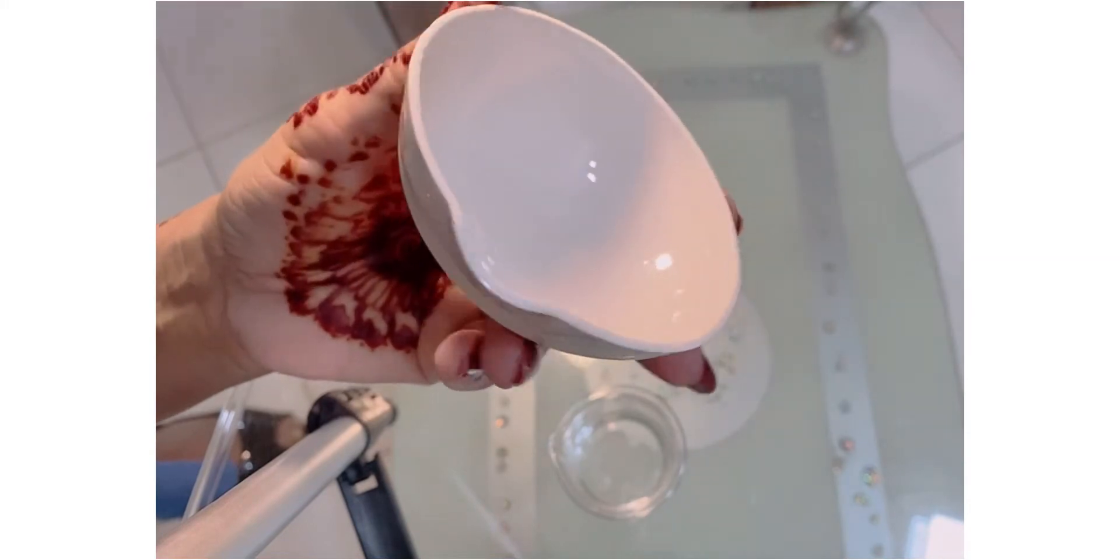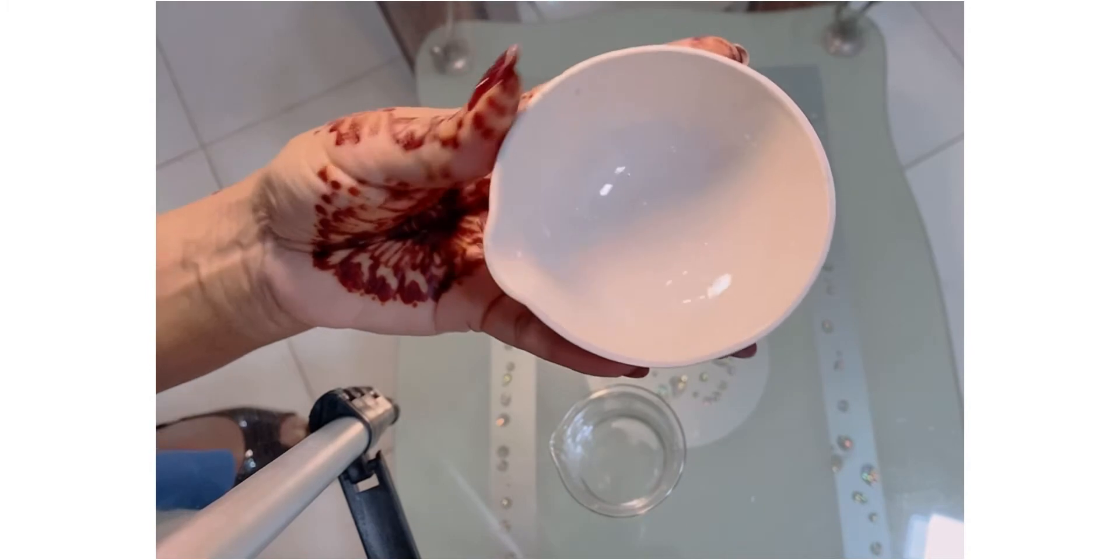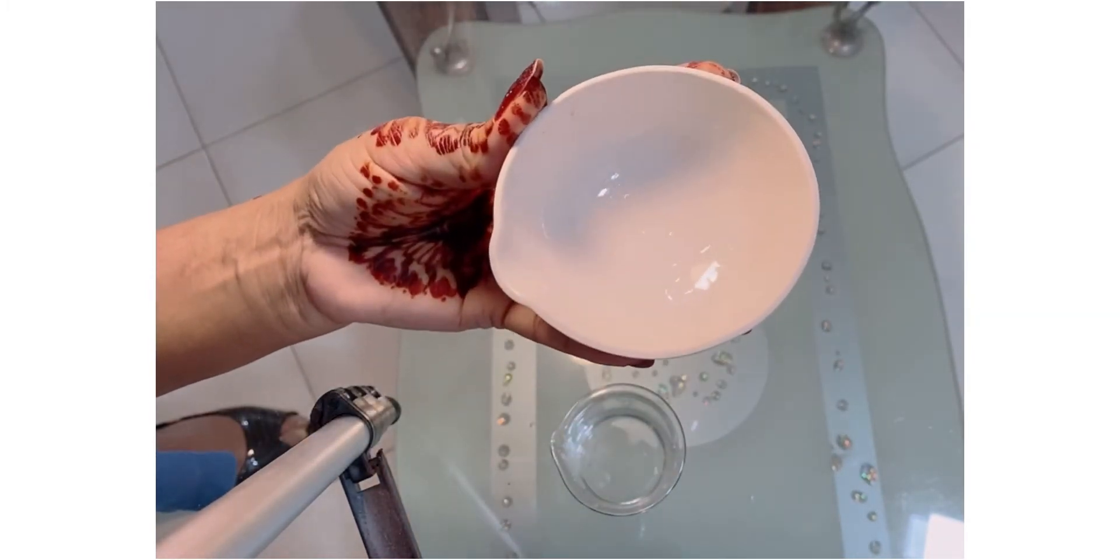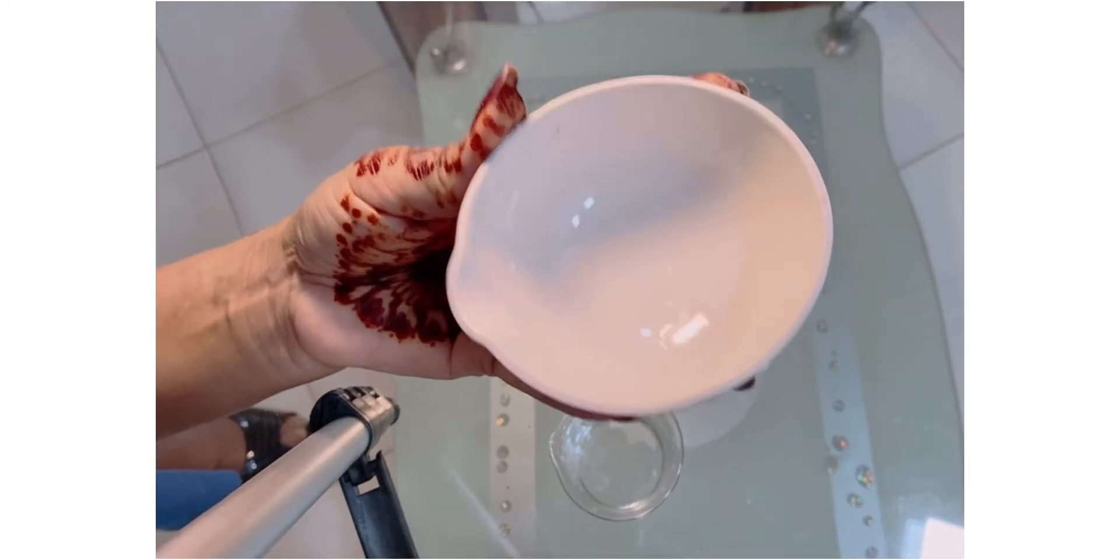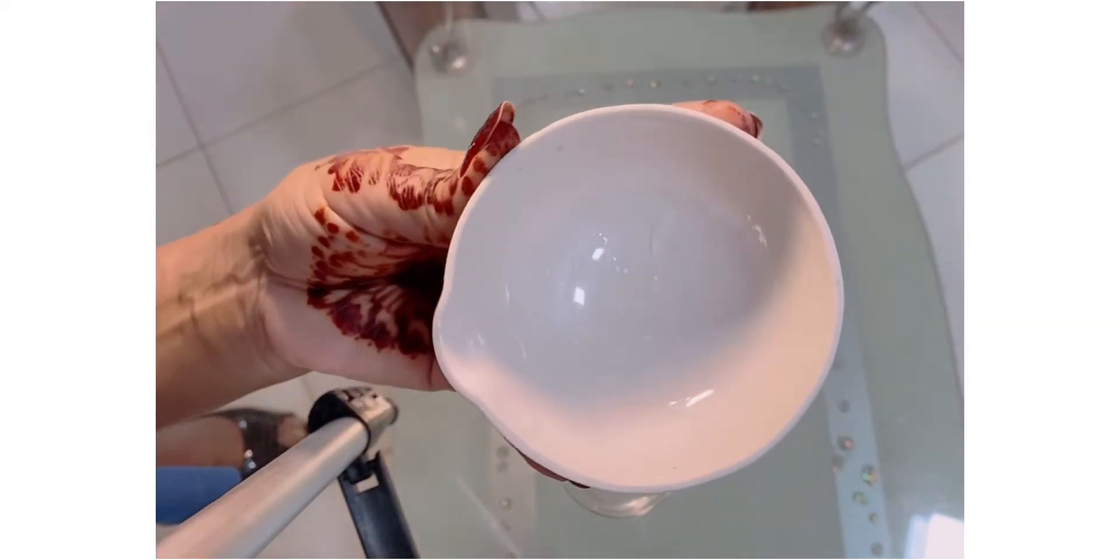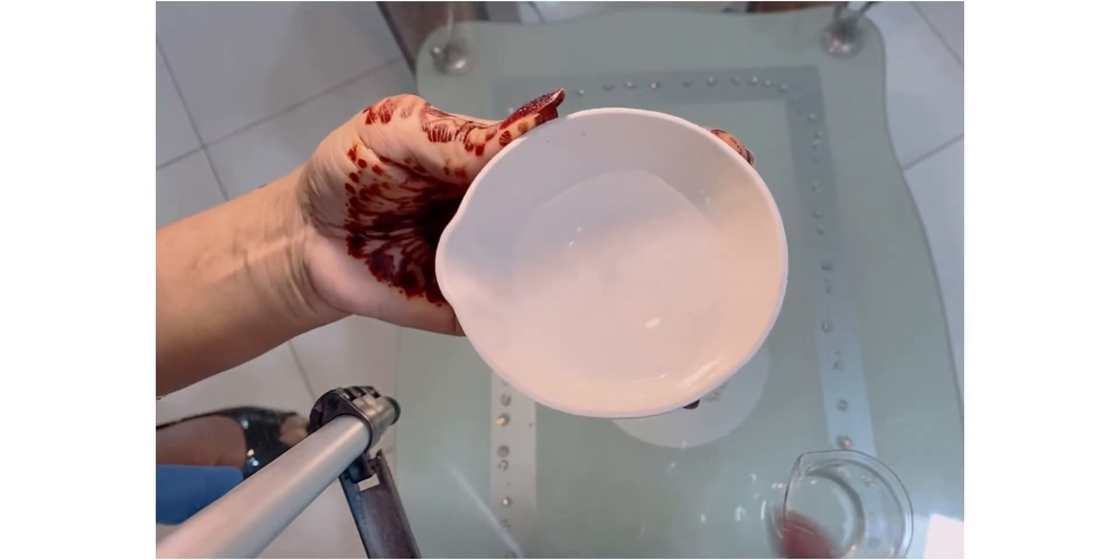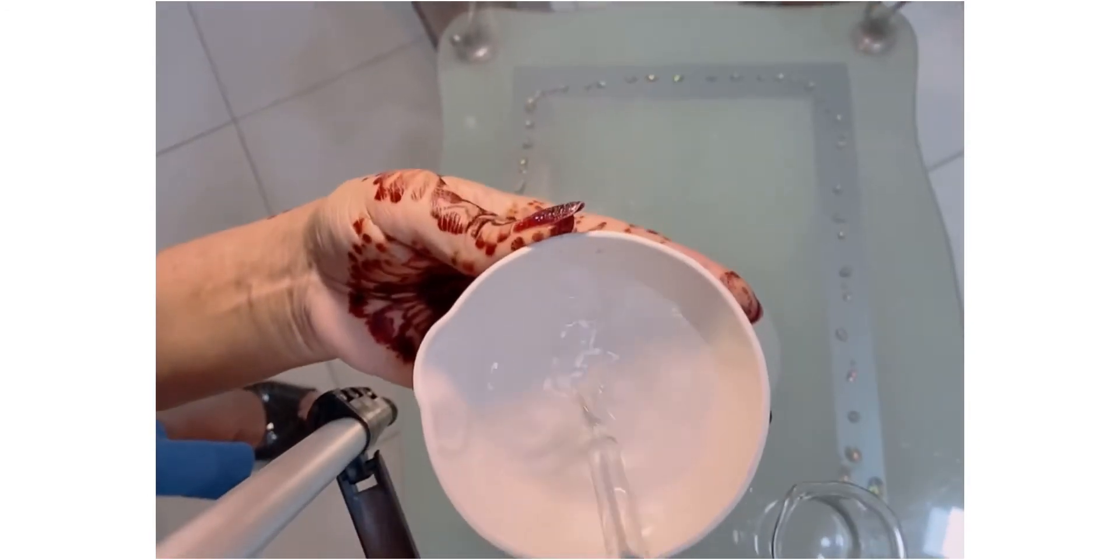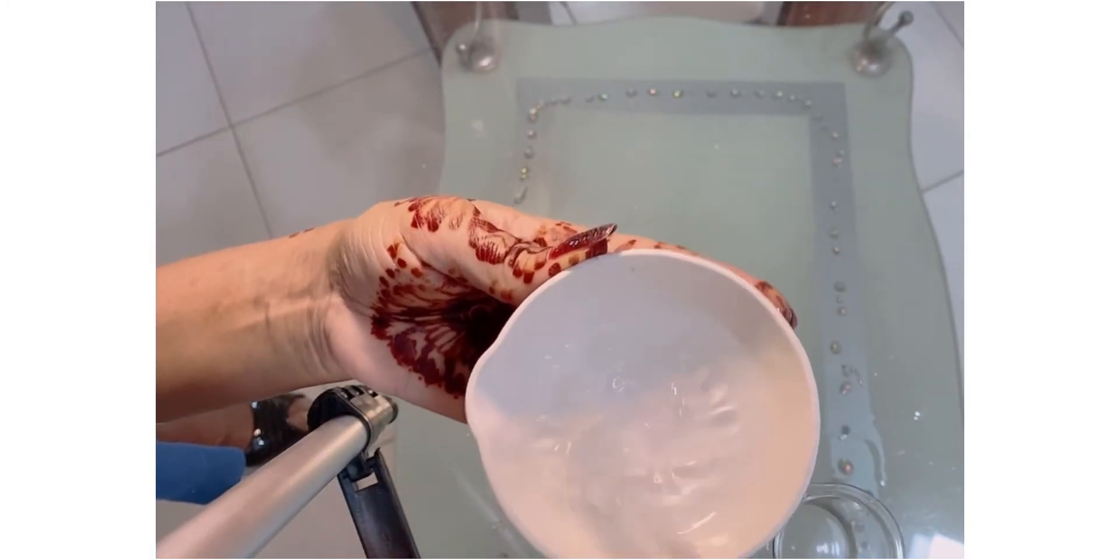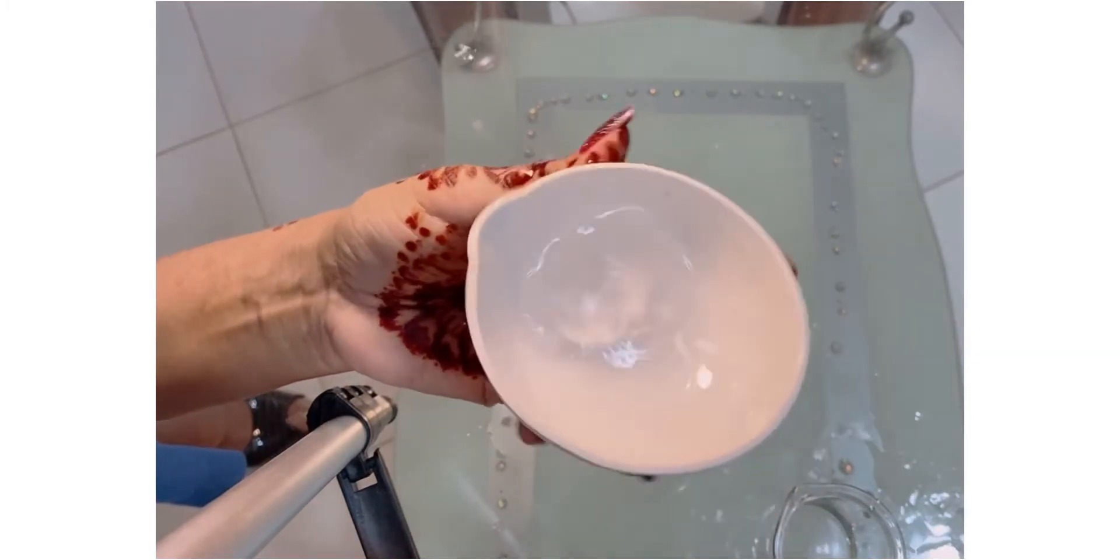We should avoid swirling or stirring. We should not - this is a glass rod - do not stir or swirl it, because the solution in this dish while heating, as the walls are very low, has a chance to spill the solvent during an experimental process. If you will simply swirl it with the help of this, like this, you will spill it. Like this, see? If you are swirling or you are stirring it, no rough stirring, no swirling. If you swirl it, see how it's spilling, right?